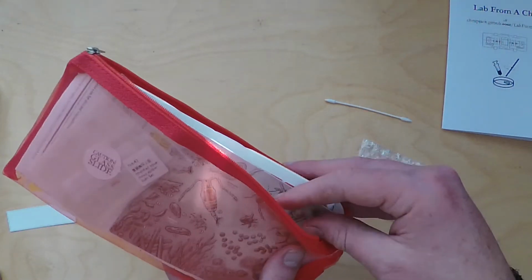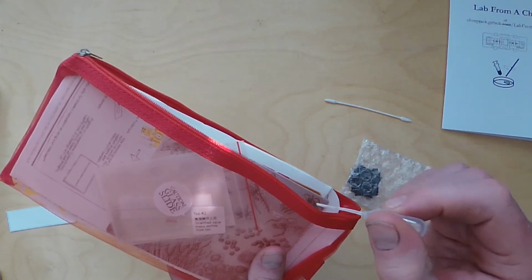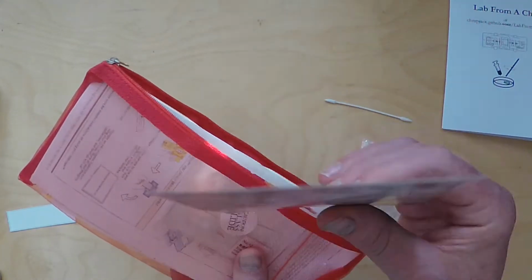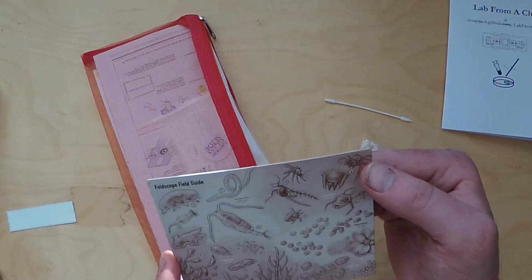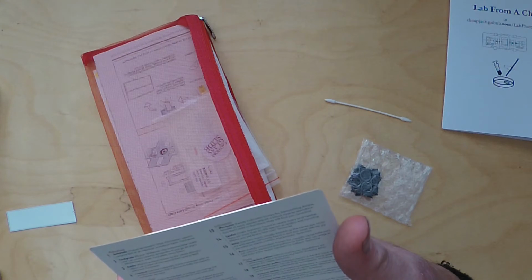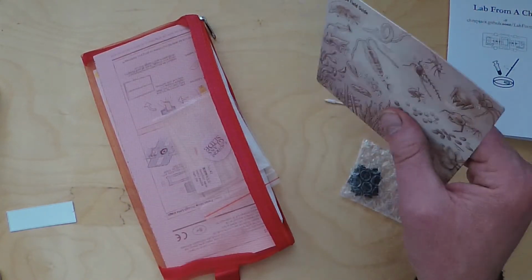There's also a tiny little hand pipette for taking out tiny drops of our algal solution and dropping that on the slide so that we can view the algae under the microscope later. You also get quite a nice piece of artwork by the Foldscope people of the different organisms that you might be able to see with the Foldscope. The Euglena are not actually on here, I don't think so. No, but there's many other organisms that you'll be able to see with the way that the lens works.